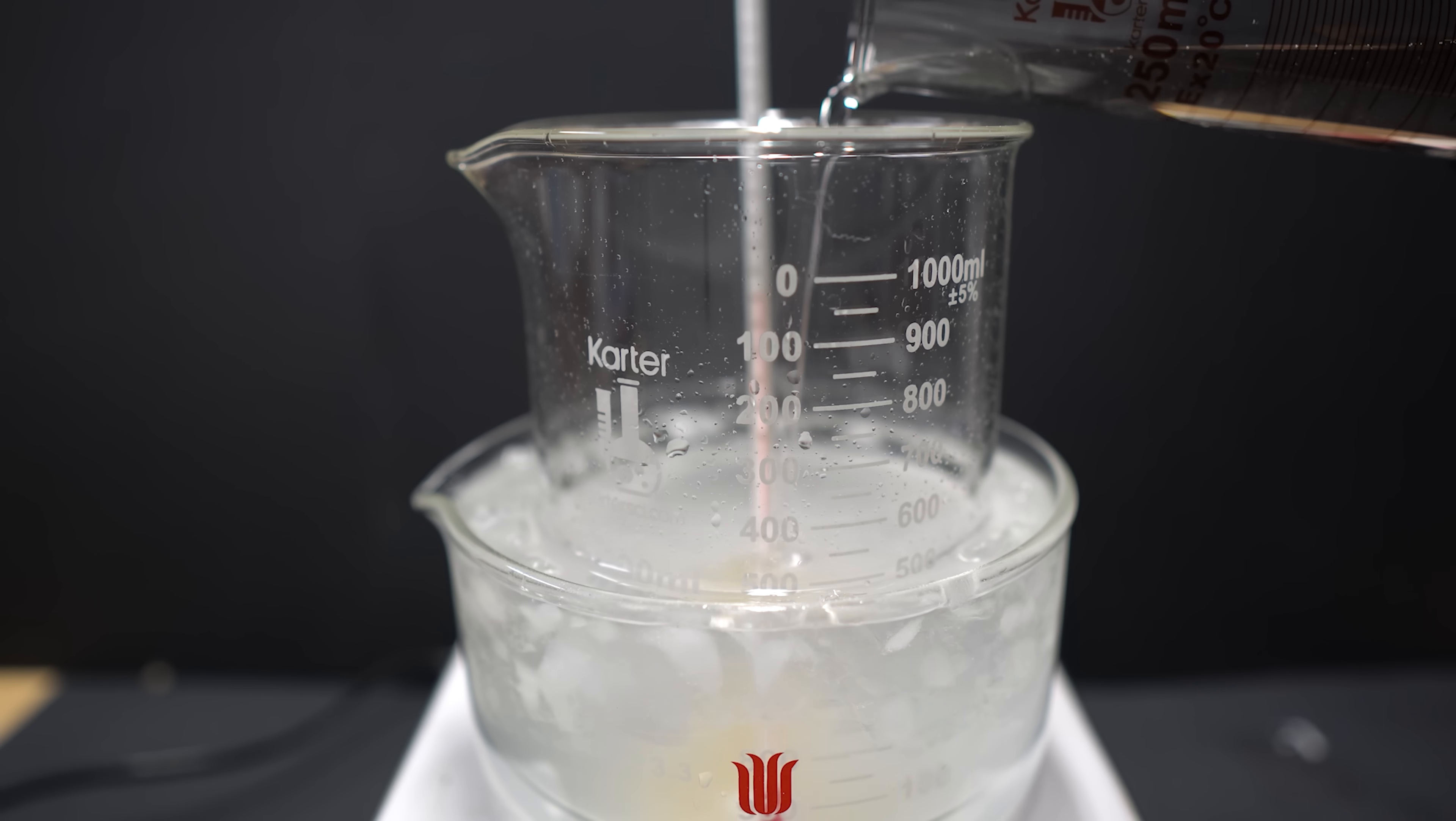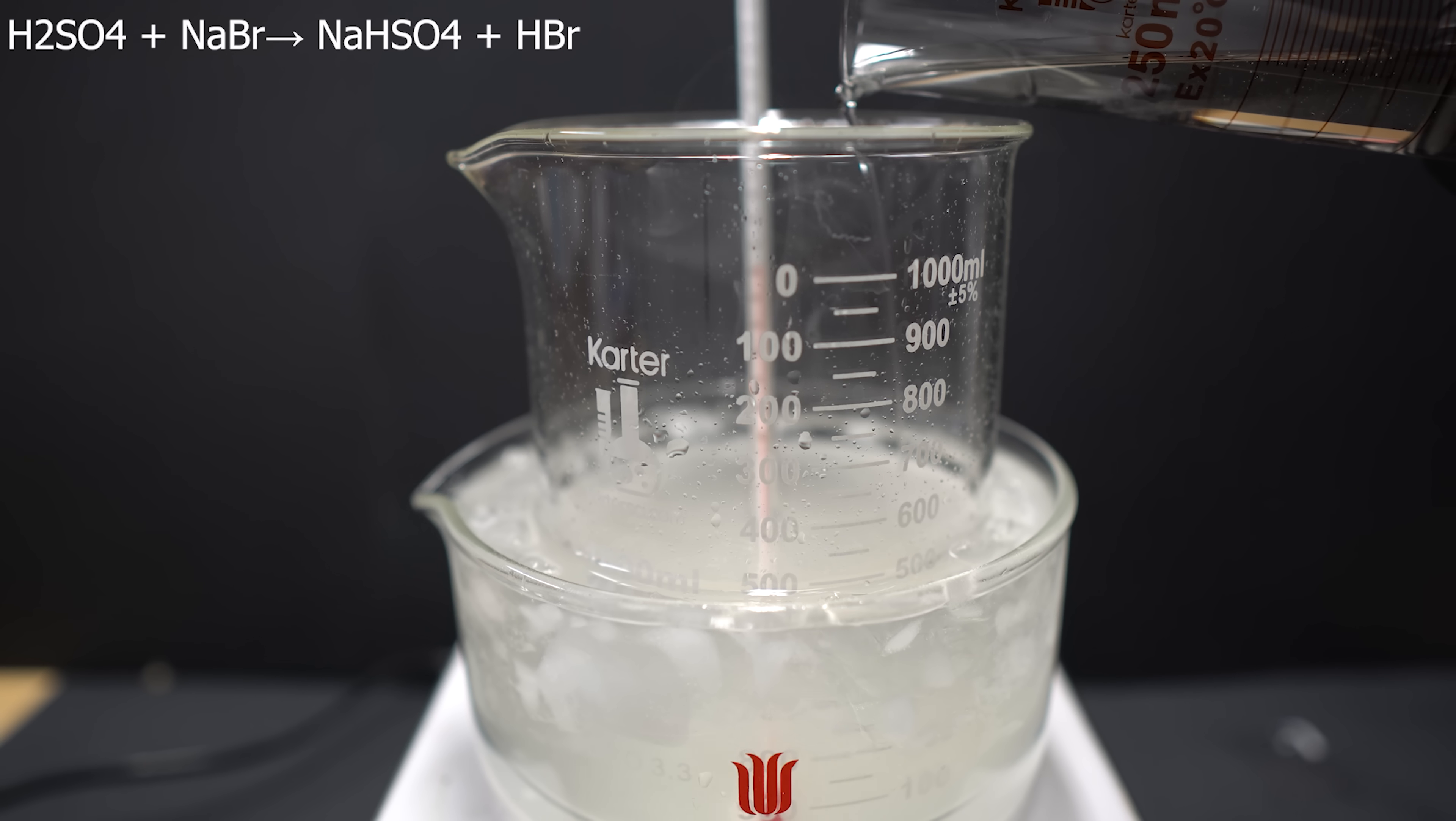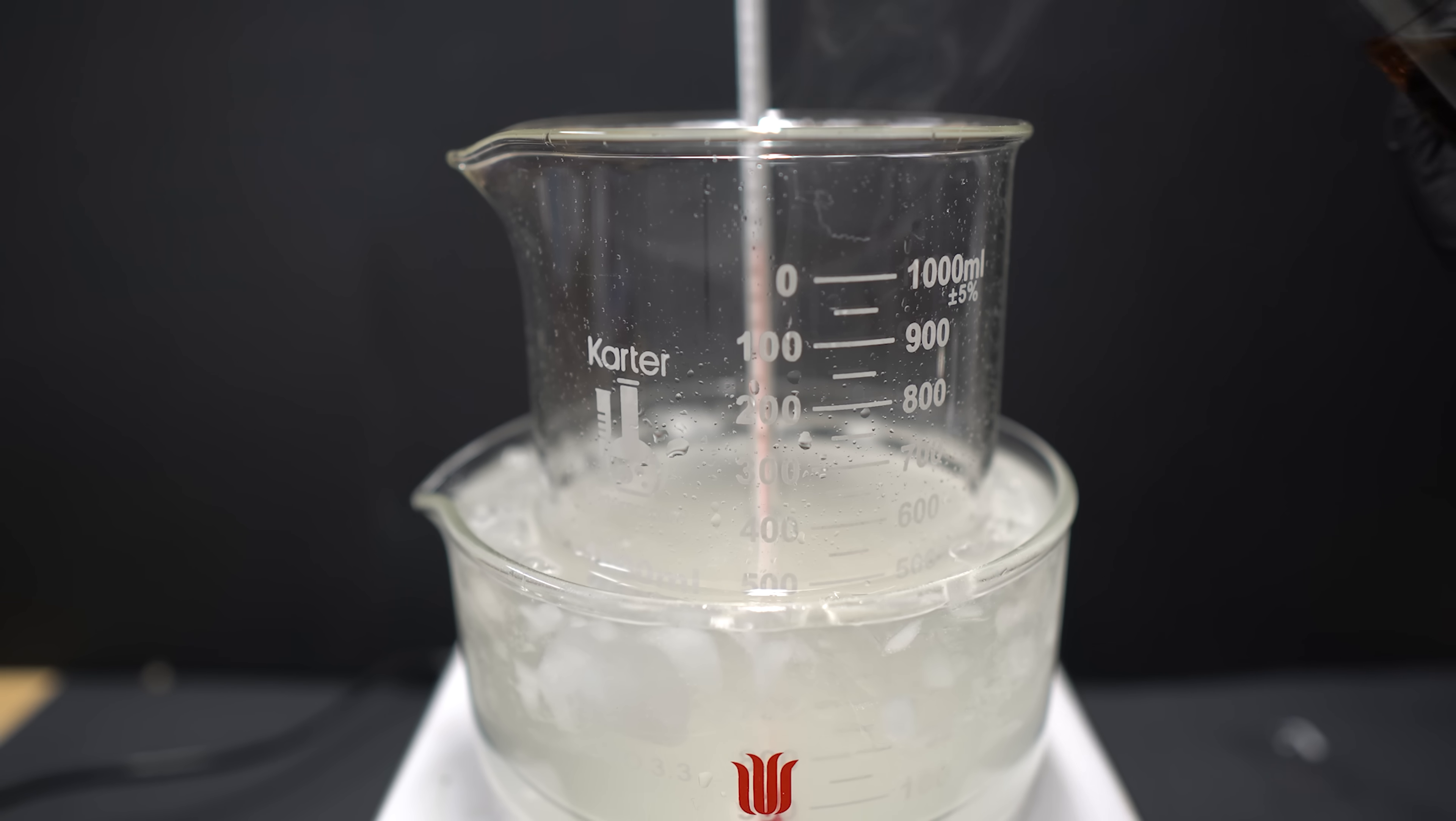I put the container into an ice bath just because this will heat up a lot when you do the addition of sulfuric acid. The addition of sulfuric acid should be done slowly, and we really don't want the temperature going over 75 degrees Celsius.